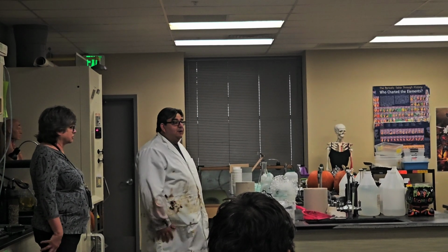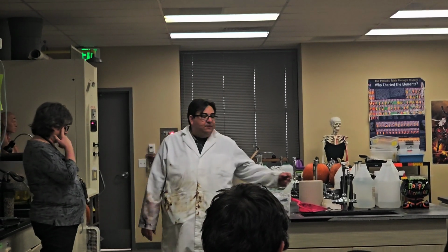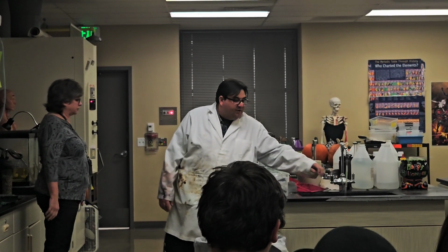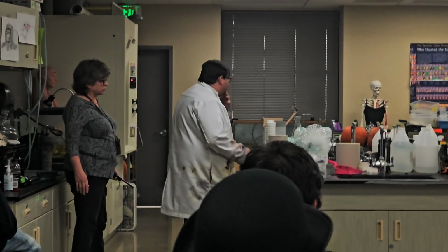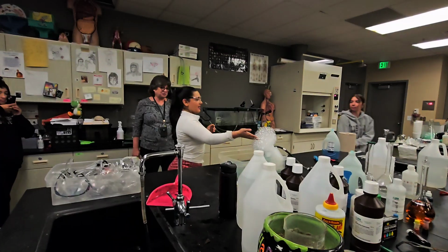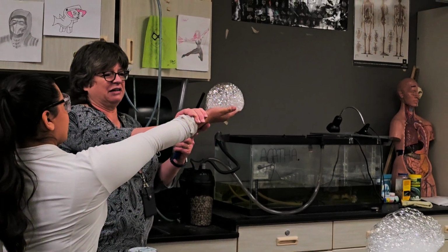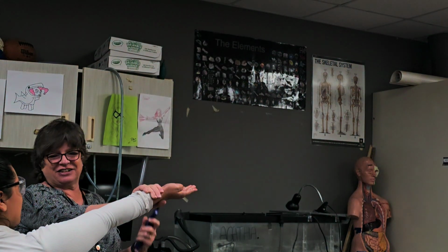I'll have all the sinks running so you can rinse your hands. So don't turn the sinks off, just leave them running so that avoids splattering. And yeah, so go ahead, line up, and I'll turn on the sinks. Dip your hands, right shot. Tuck your thumb in. Ready? Good job.